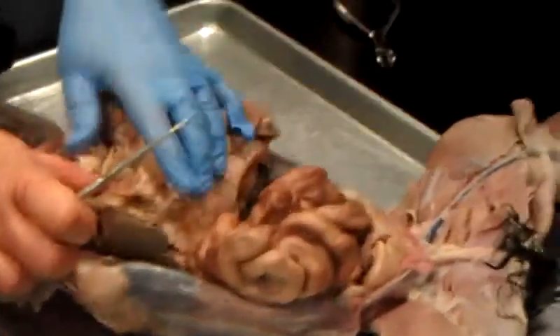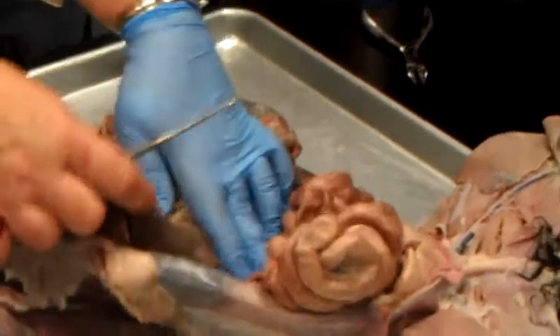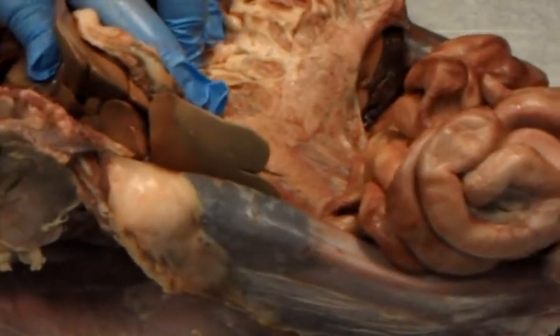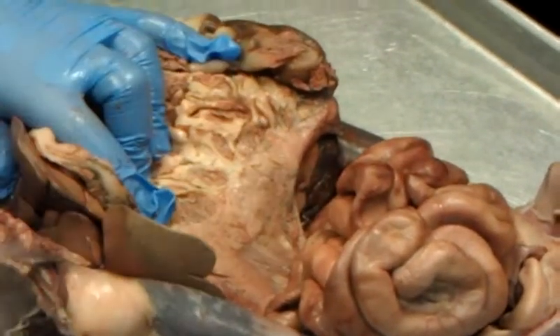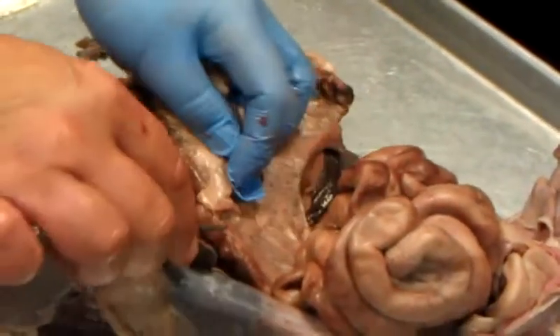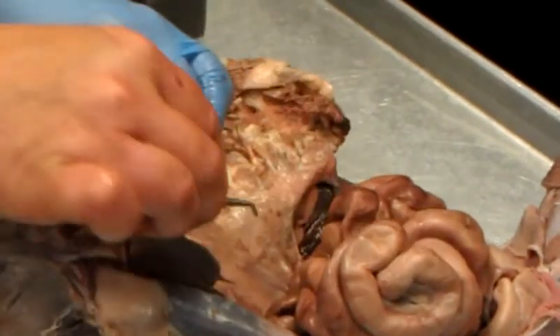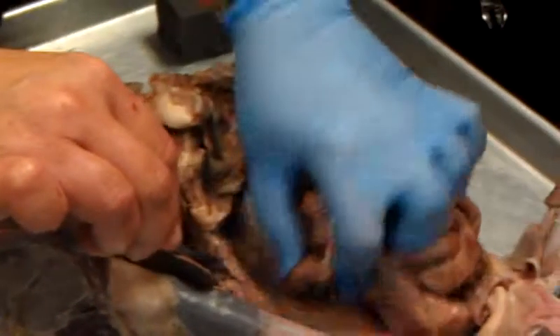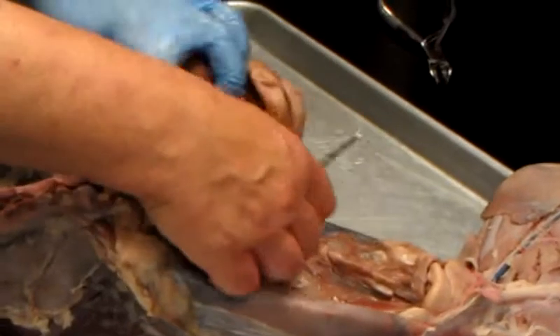Underneath the stomach here, what's this thing? This is the pancreas. Wait, where's the pancreas? It's right there. Actually, I think it looks just like my picture. Yeah, it does. Head, body, what? Tail. Now, this is the duodenum. Because see, the stomach is going to connect right there. This is the duodenum. The head of the pancreas is sitting in the what? Duodenum. Then the duodenum, see the pancreas down here? Duodenum. Then it's going to start to curl.